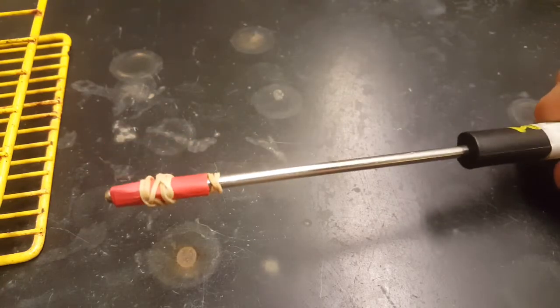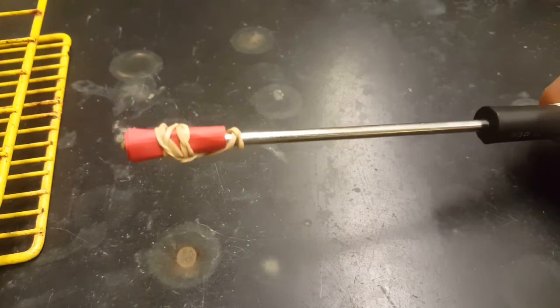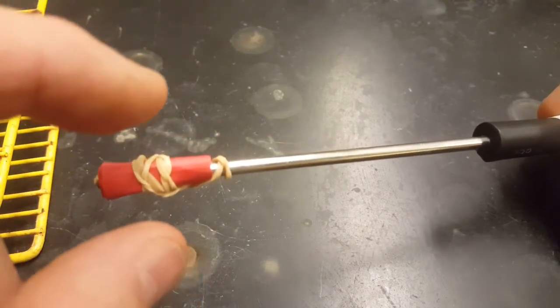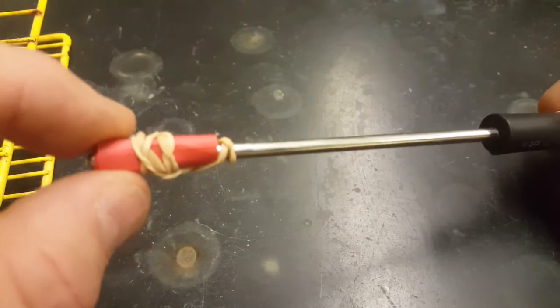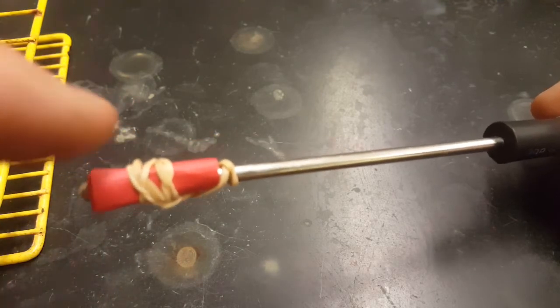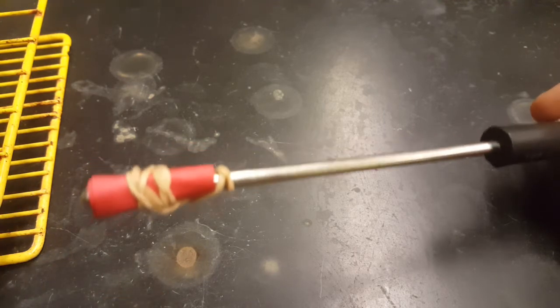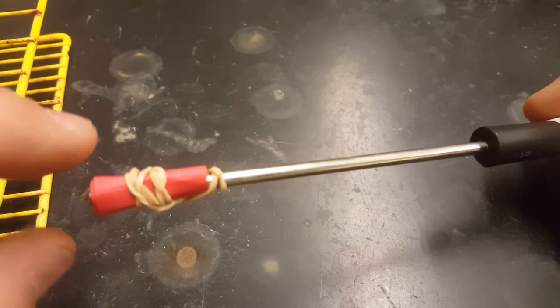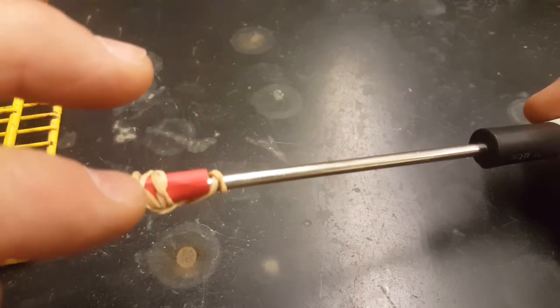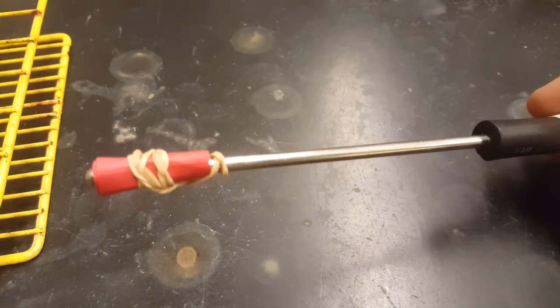We're doing 4 alcohols today, but the lab directions ask you to test everything out with water first. And so we'll have some water soaked into the piece of paper, and then you'll just follow the directions with water like I'm about to demonstrate with the alcohol. But do water first, get the hang of it, get 5 pieces of paper, 1 each for the 4 alcohols, and then 1 for water, just so you can test your systems out.